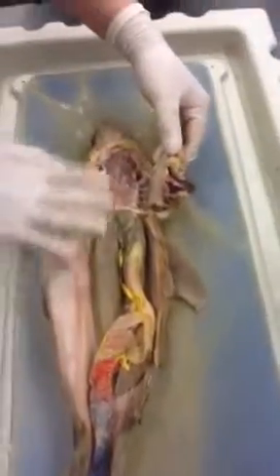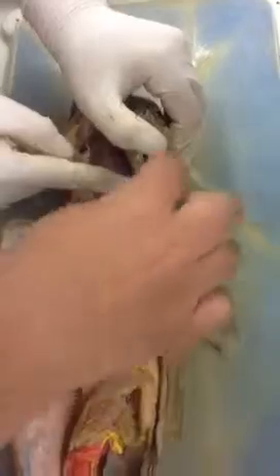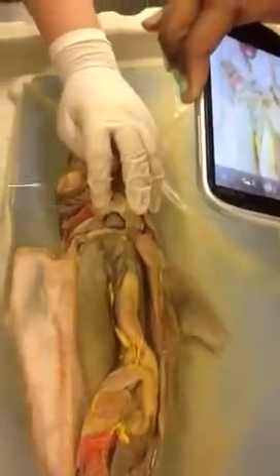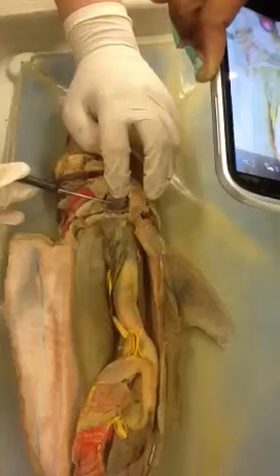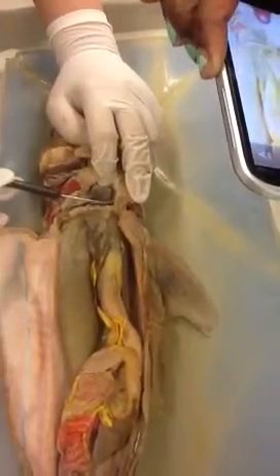So, tracing blood flow, the heart is actually right there. If you pull this down, you can pull that skin out. There you go. So the bottom portion, that little gray part on the bottom, that's the sinus venosus. The thing directly beneath it is the atrium. The atrium's on the back of the heart.